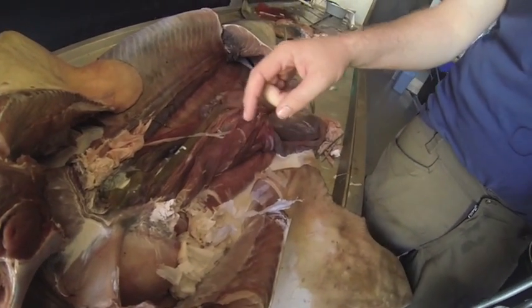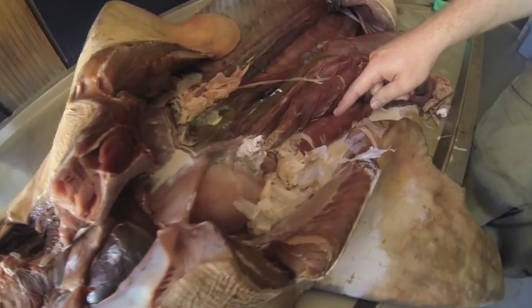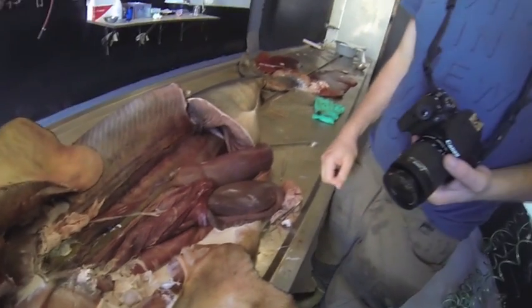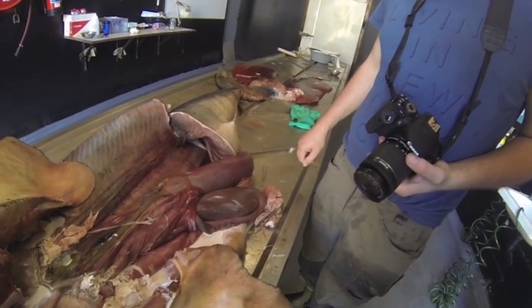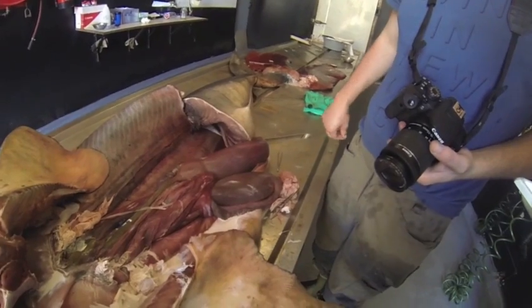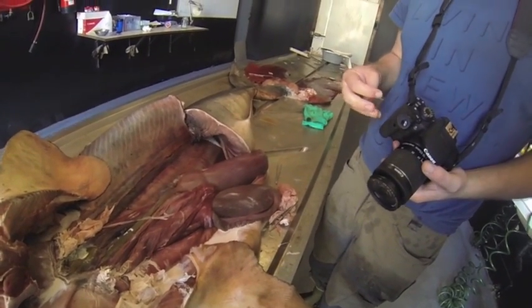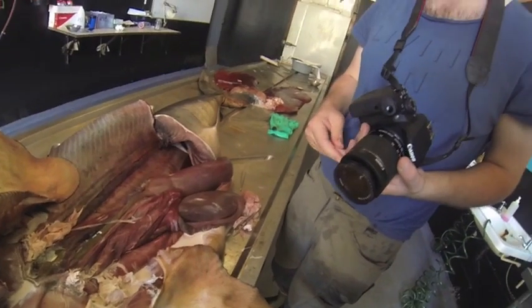The vascular system of the white shark seems to be very complicated, and it's a long story that can't be contained in this short film, so we are happy with this first trial. What we do now is we just leave the animal, let the latex sit, and we will later today try to get into the deeper tissues, and then we can hopefully look at it tomorrow.